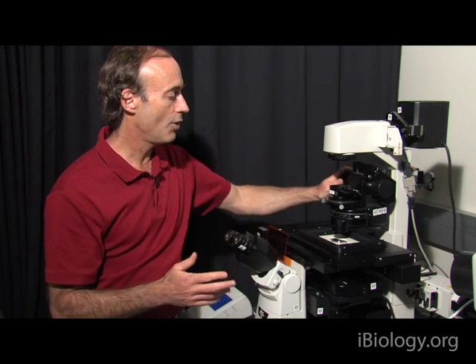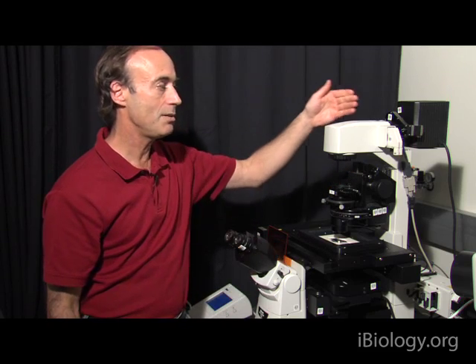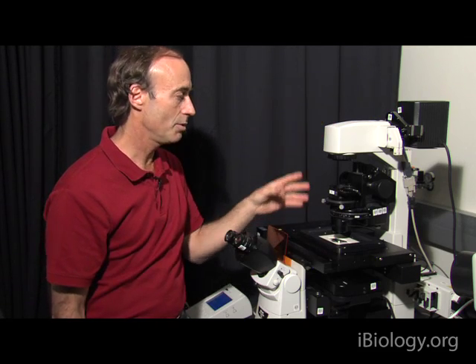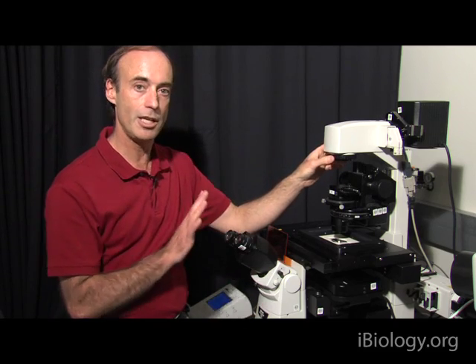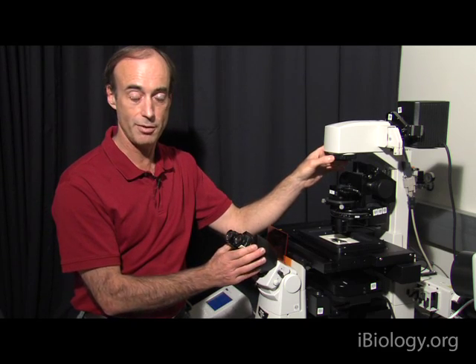The main goals of Köhler illumination are twofold. First of all, we want to focus this condenser lens so the image of the field diaphragm is projected on the specimen plane, so that when we open and close this field diaphragm, we can see a clear image of that field diaphragm through the eyepieces of the microscope or through the camera.